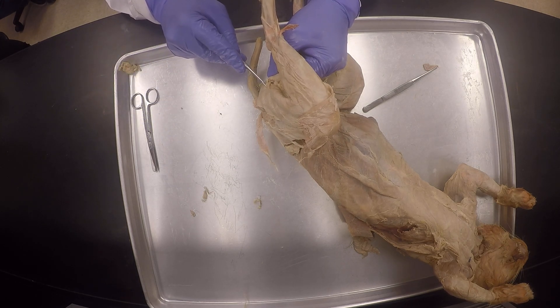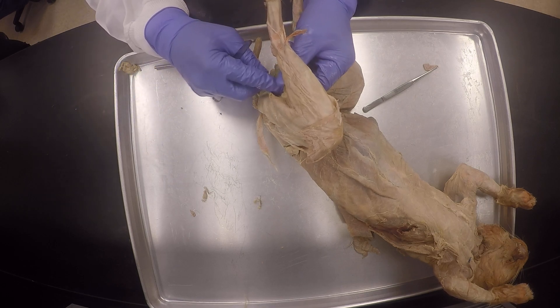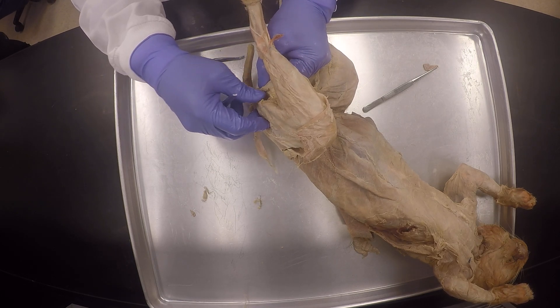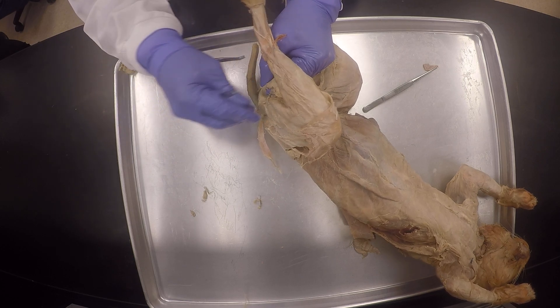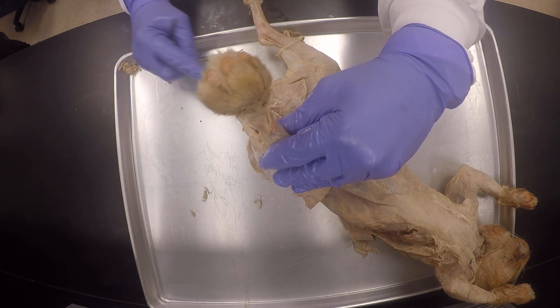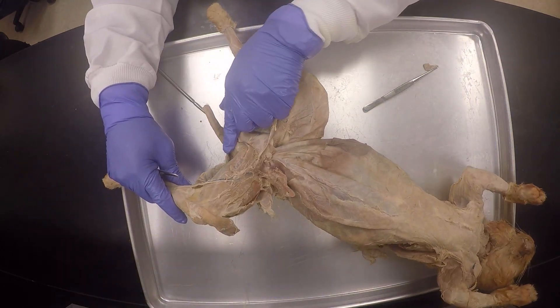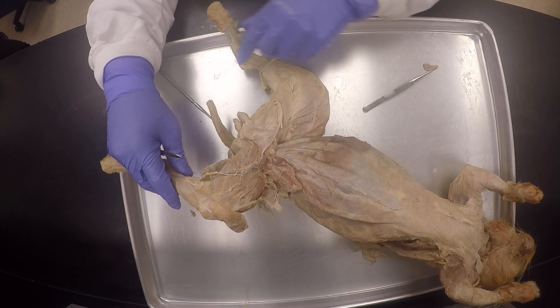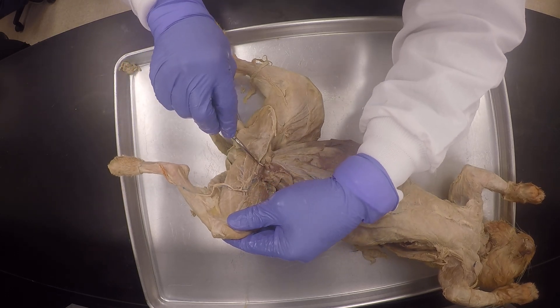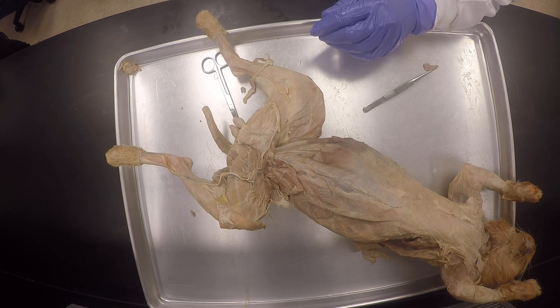So after this, when I'm done with this and we do the rest of the lower limb — the leg — once we do the leg, then we are golden and we've got all the muscles. You see how I'm going to just leave this connected like that? This is not supposed to be torn like that. The one that looks like a tendon or like a cable is the semi-tendinosus. The one that looks kind of flattish like a membrane — semi-membranosus. And then we can see there's the division between the semi-membranosus and the triangular muscle, which is the adductor femoris in the cat and the adductor longus in the human.